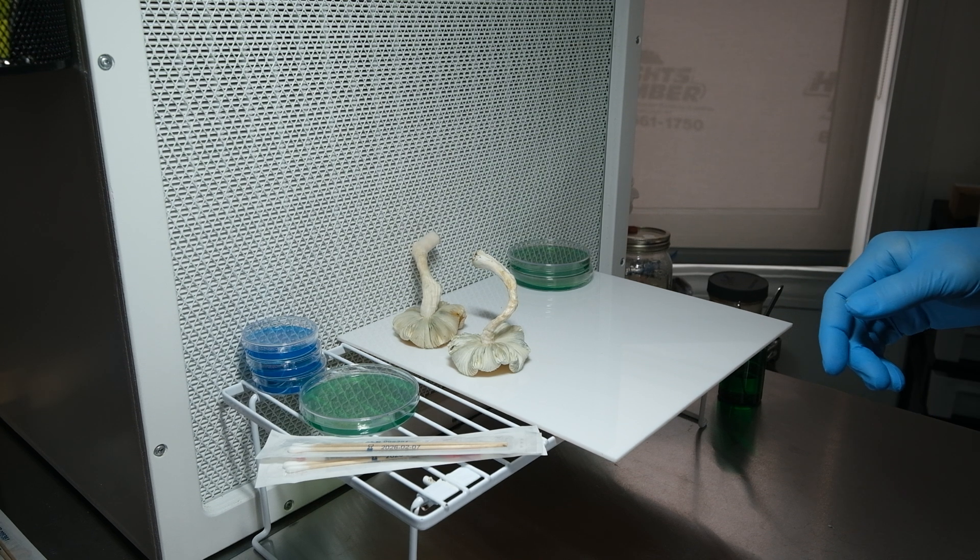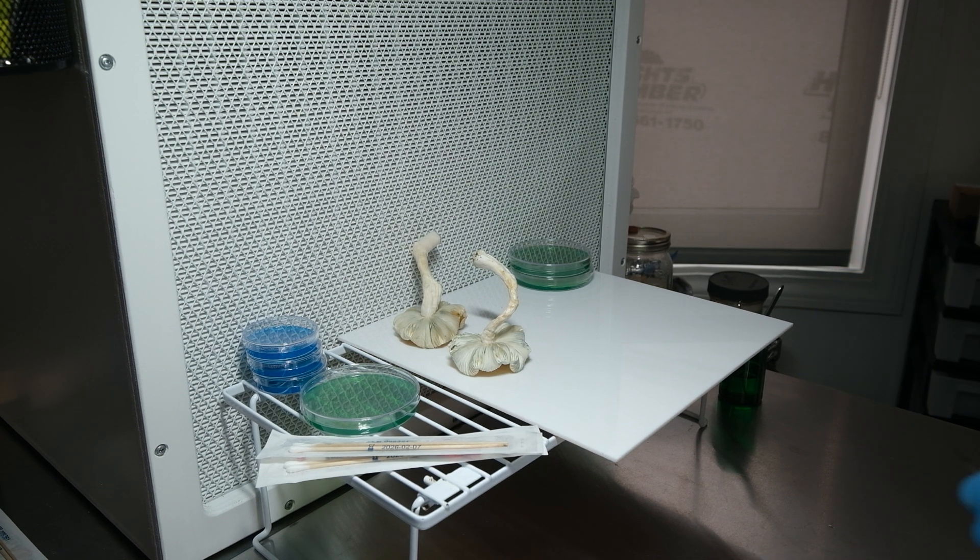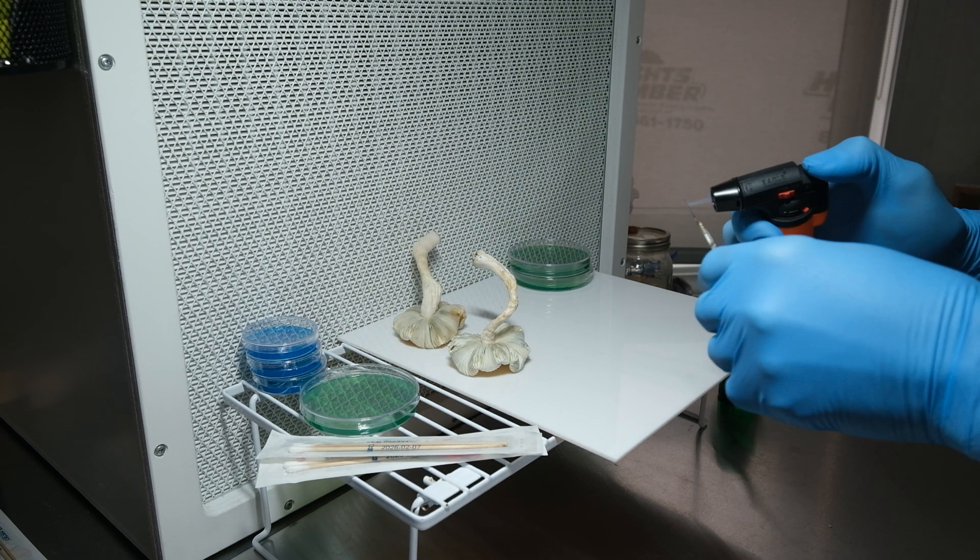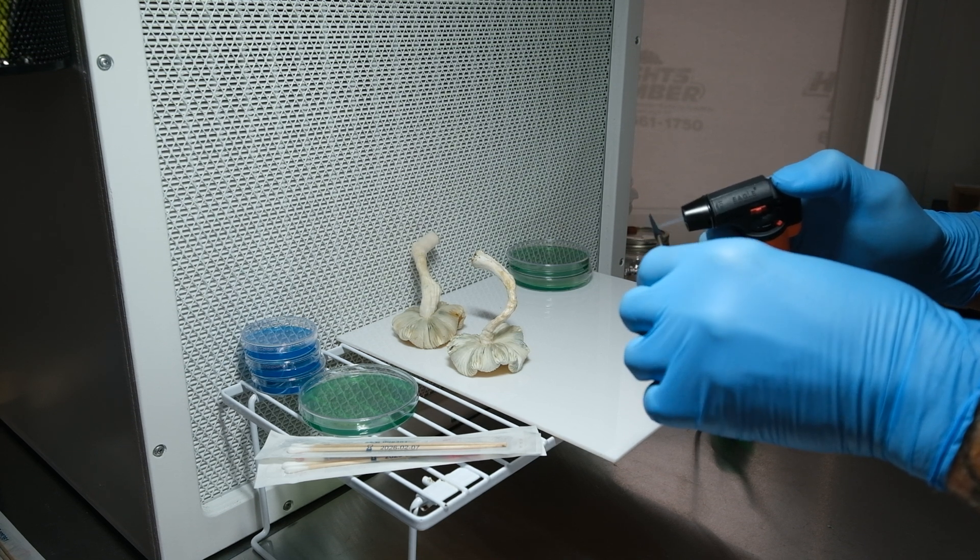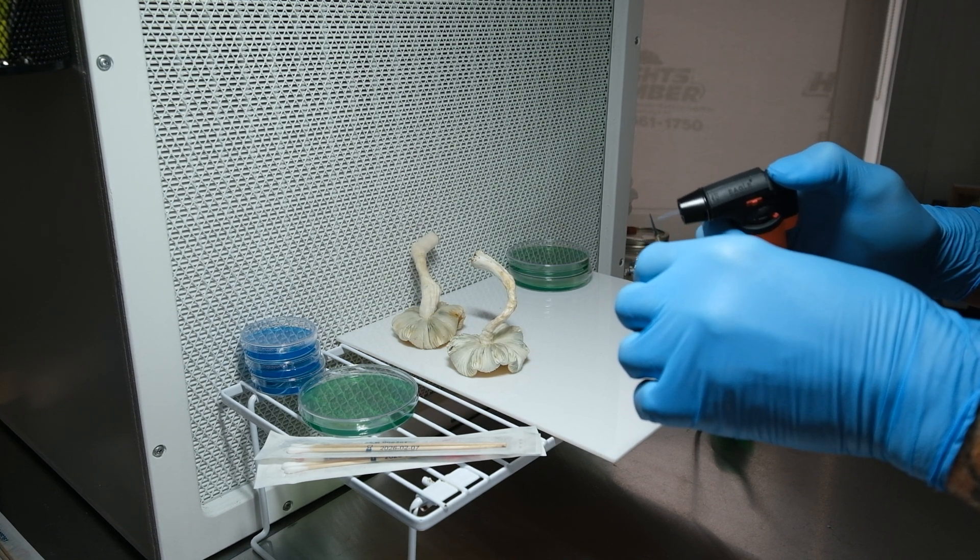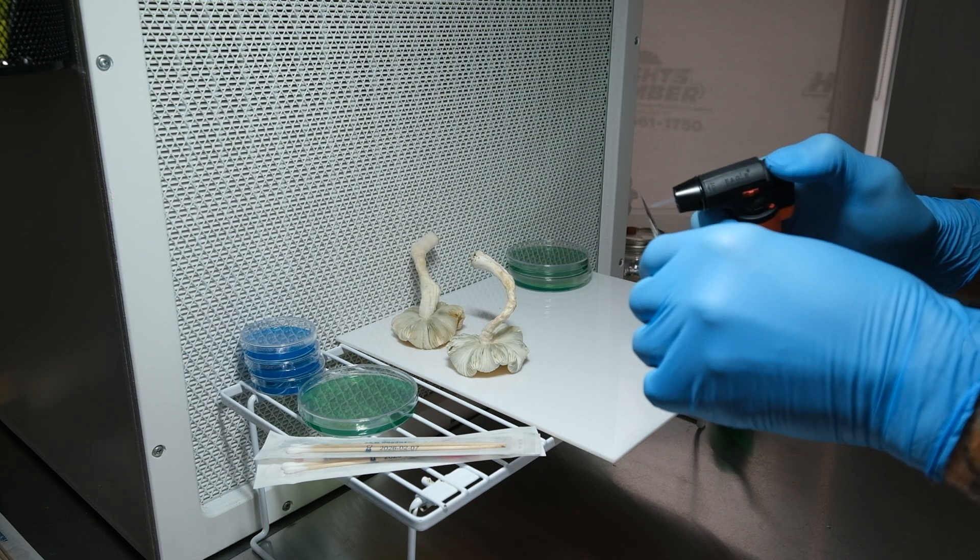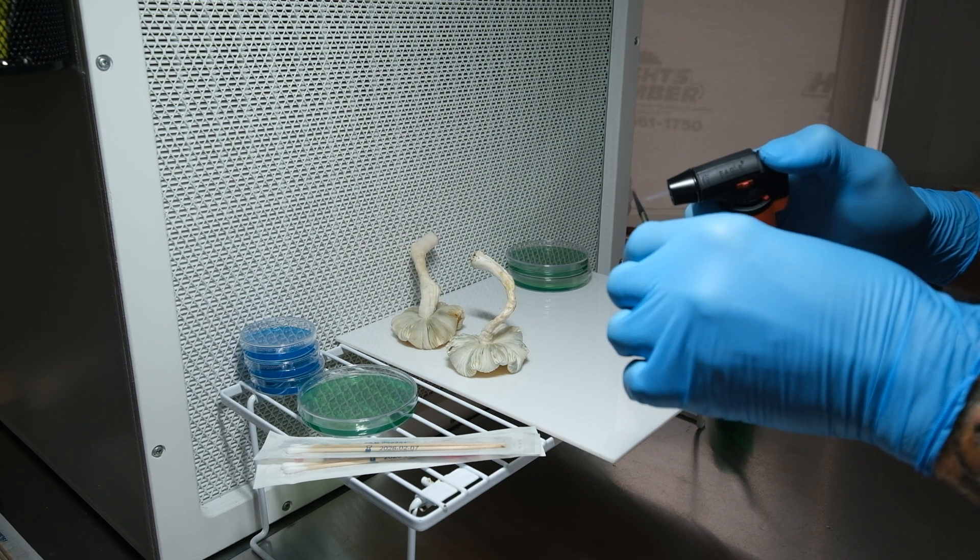So sterilize my scalpel here. We're gonna clone these two fruits and I'm gonna swab them, and then I'm gonna make some multi-spore plates today. So that's what I'm after right now. I want to start a bunch of spore plates from this leucistic strain that popped up in one of my tubs.